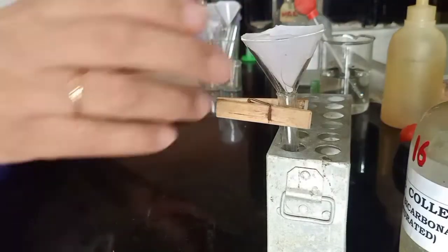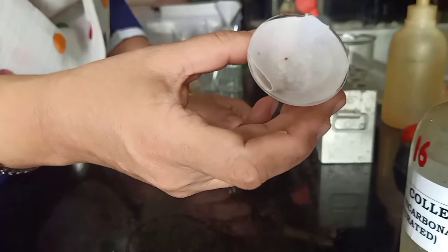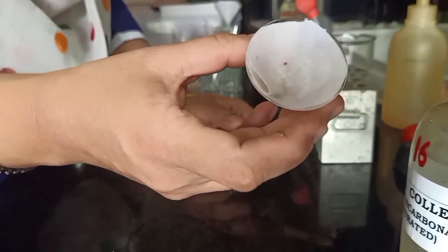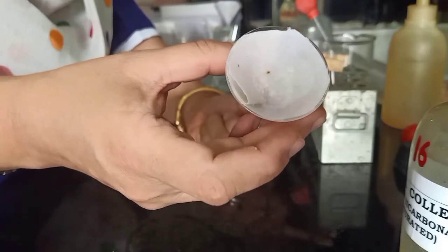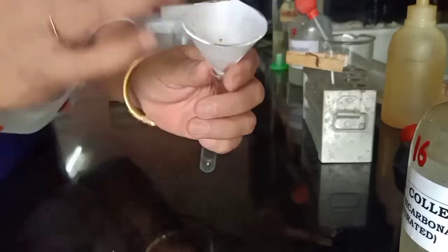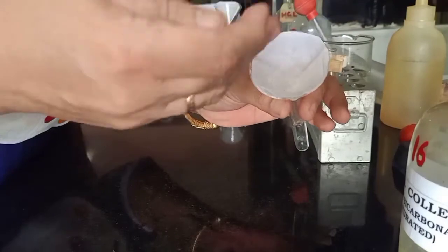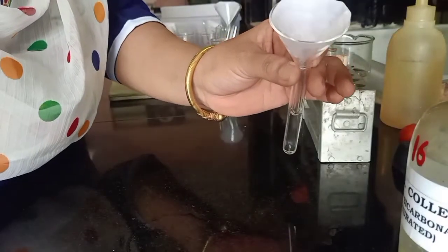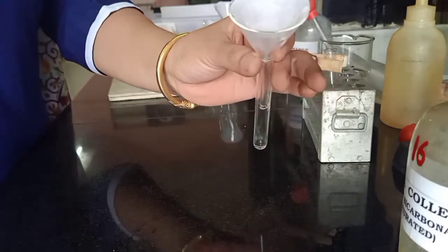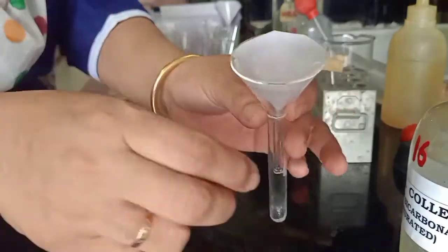Let's go ahead and check for the next component. We have checked for an acid — we assumed because we got effervescence we might have an acid, but we did not get re-precipitation so it may be a water-soluble acid. Now let us check for the nature of component B, the second component. We will now proceed for the test for phenol. Because we are working with very small quantities, we make a hole in the filter paper using a sealed capillary tube and add the corresponding reagent. We have washed with bicarbonate and with water, and now we are proceeding to treat this with the reagents for phenol.